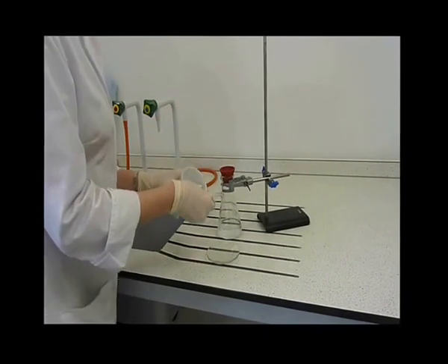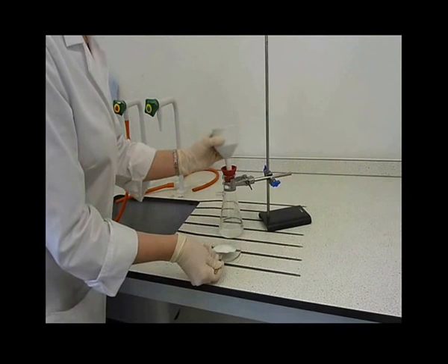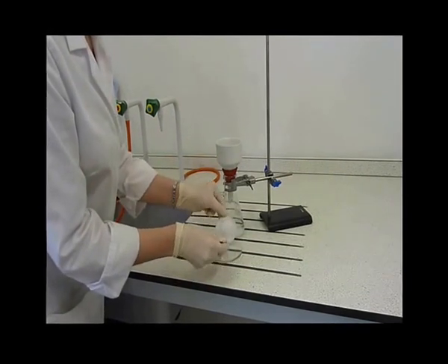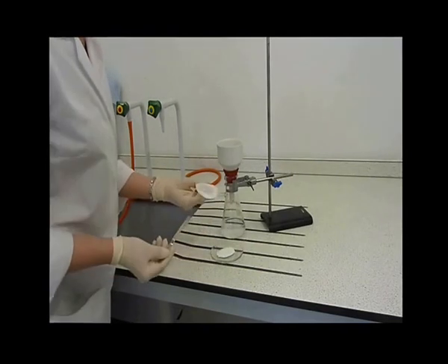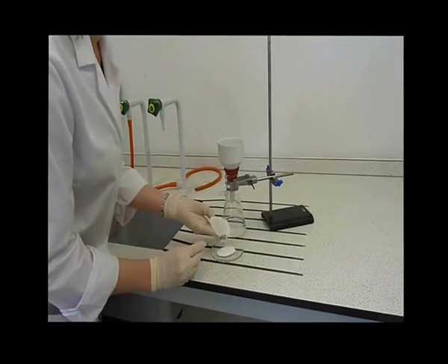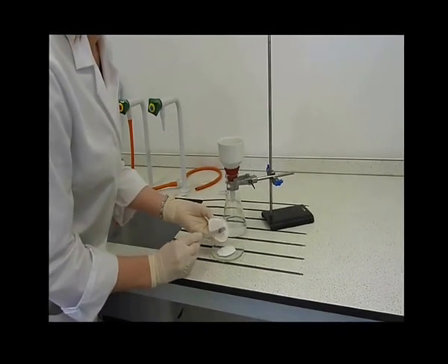Carefully transfer the solid to the pre-weighed watch glass or specimen vessel. This can be easily done by gently lifting the filter paper with the solid and placing it upside down on the watch glass. Peel away the filter paper.